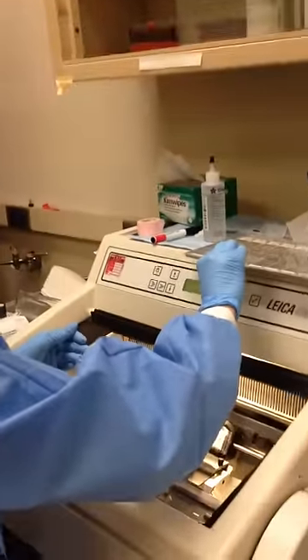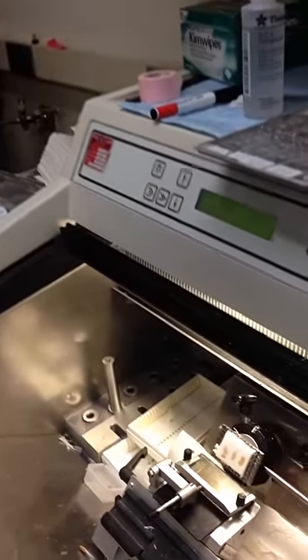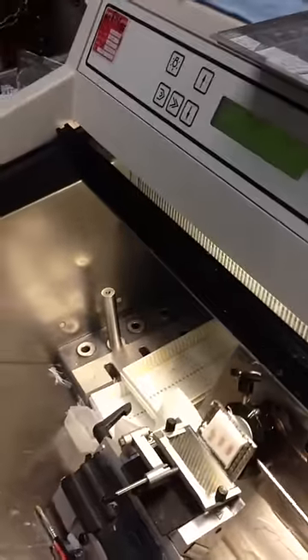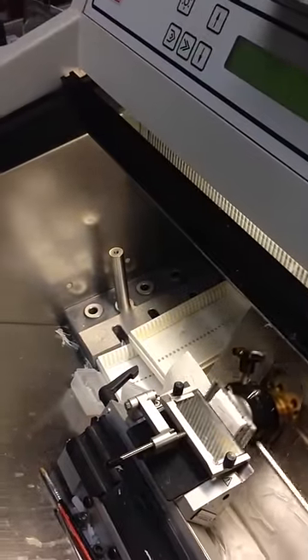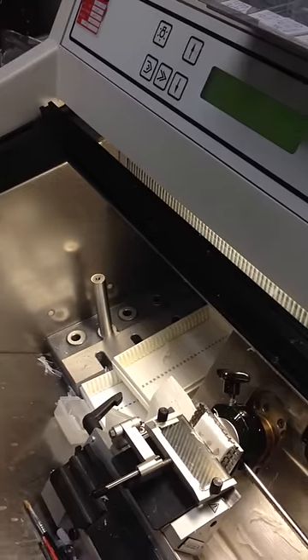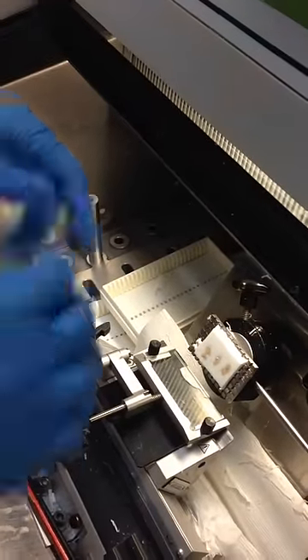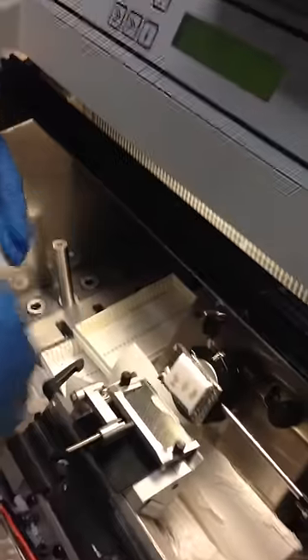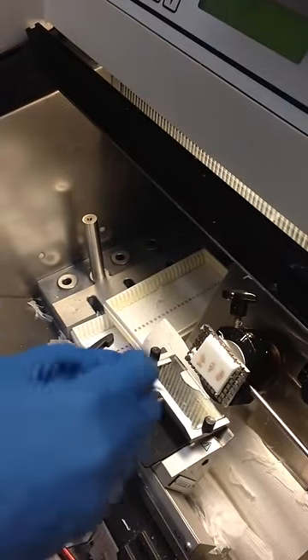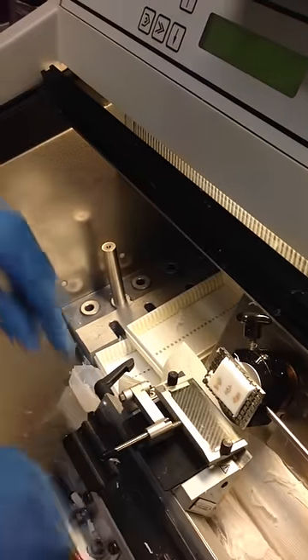Watch me cut a really, really thin slice. Here you go. And it's not working — now it is. So those are then collected. Normally the slice would obviously be really flat, really nice looking. Let me just collect this thing right here.